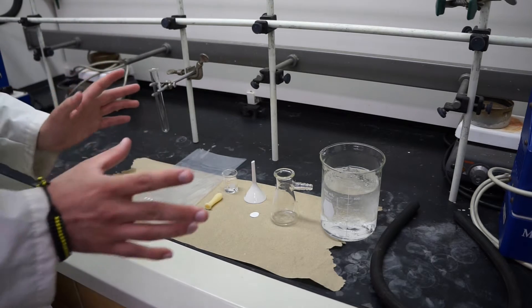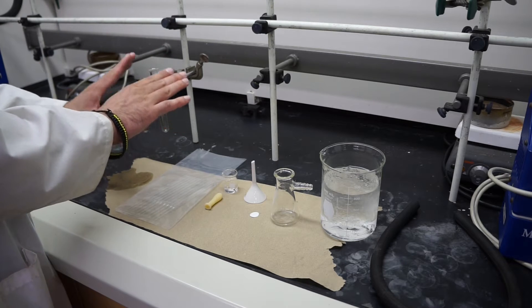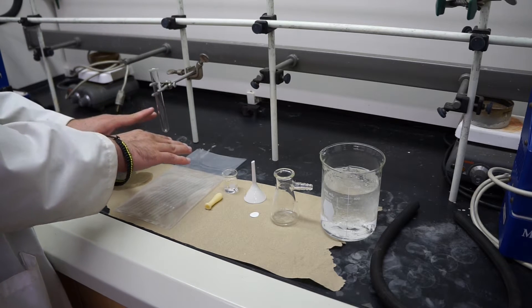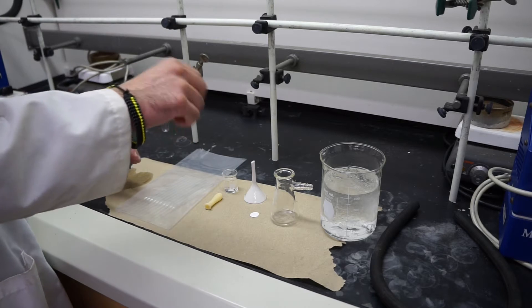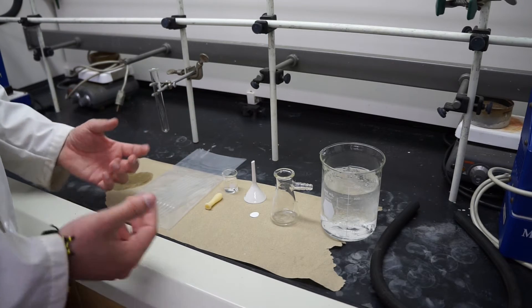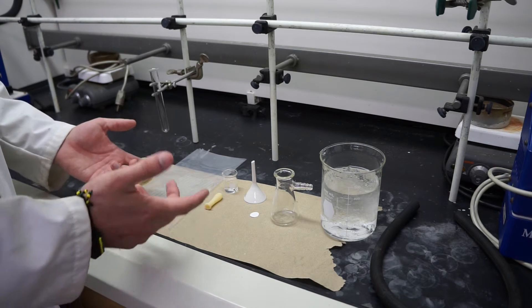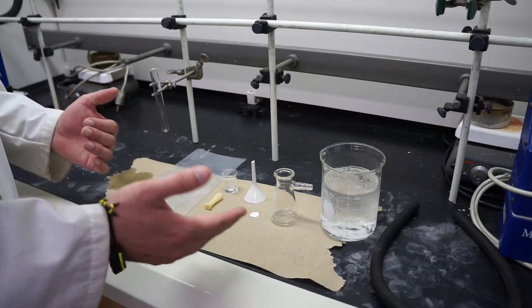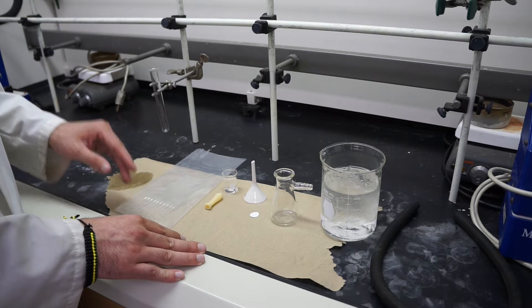Now the reaction by itself is going to run without you doing anything to it. All you have to do is swirl it a little bit but oftentimes you're going to see the crystals form within 10 seconds of adding it. If it takes a little longer sometimes it does, but you should see orange crystals.